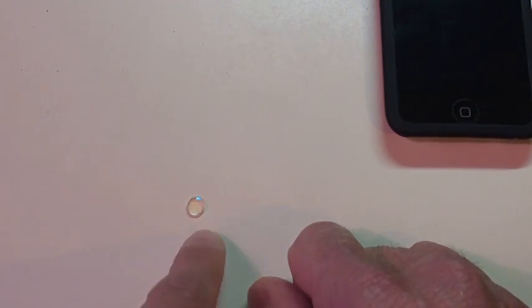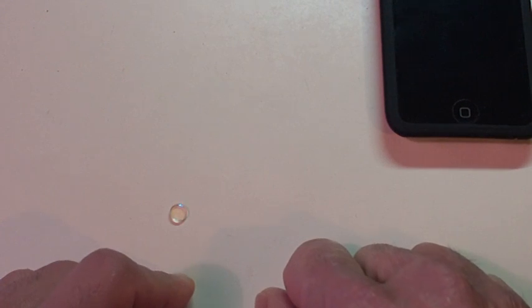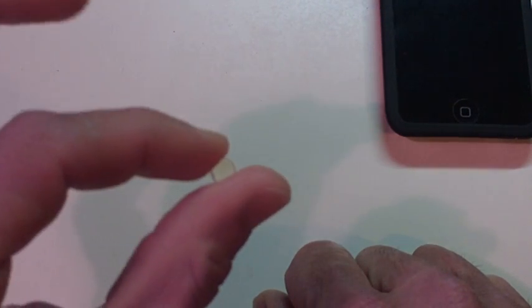And this one, it's a really, really good lens. I don't know what it's made out of, but it's really strong. It's a simple, little, tiny lens, as you can see.